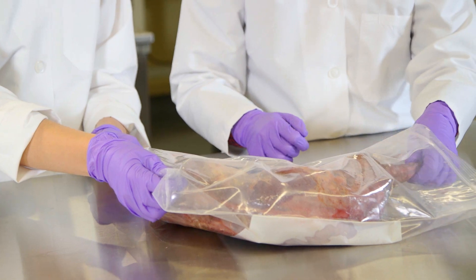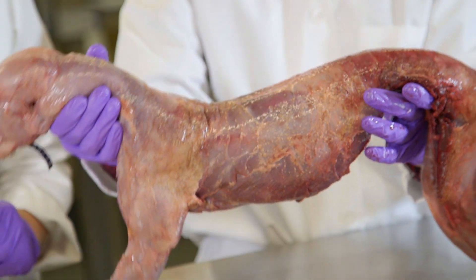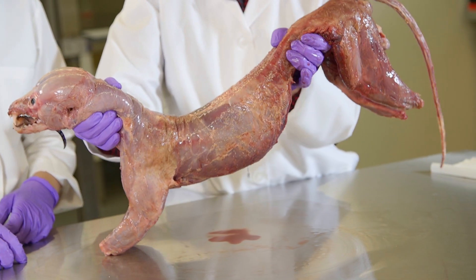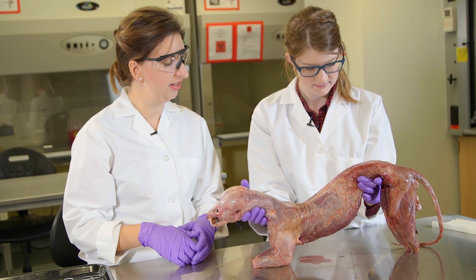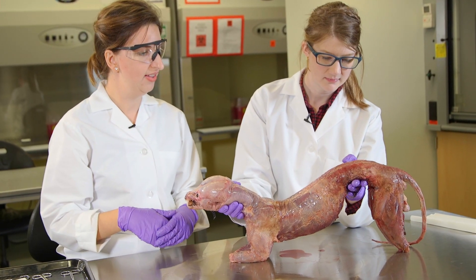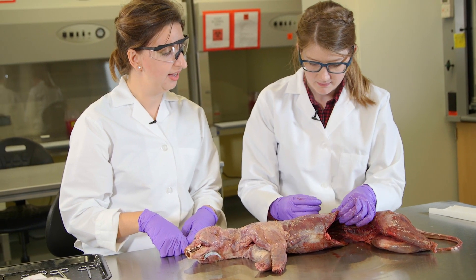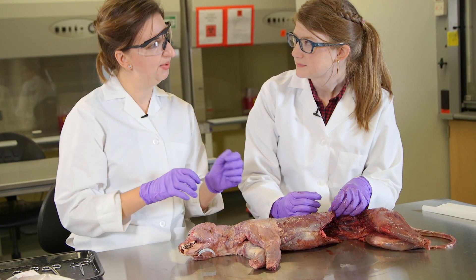If I hold this up, you can already sort of see that the ribs, the thoracic vertebrae, and all the muscles that attach to them are kind of contained in that area, and then there's nothing here at the lumbar region. Mammals actually have a region that's free of ribs called the lumbar region, and that's different from some of the ancient mammal ancestors — the synapsids — which had ribs pretty much all the way along their trunk. You can see where that would have perhaps inhibited a bit of movement or range of motion. But also the individual shape of the vertebrae and how they fit together is really important for determining how much mobility can happen at each joint, and that's what we want to get a handle on today.